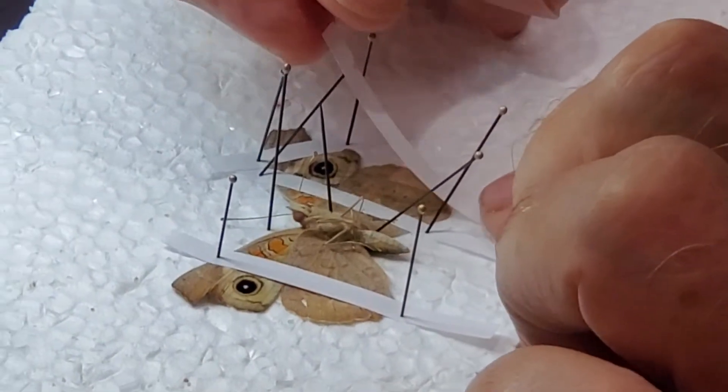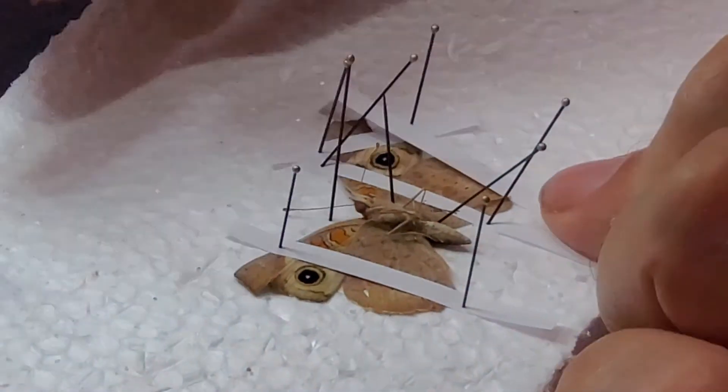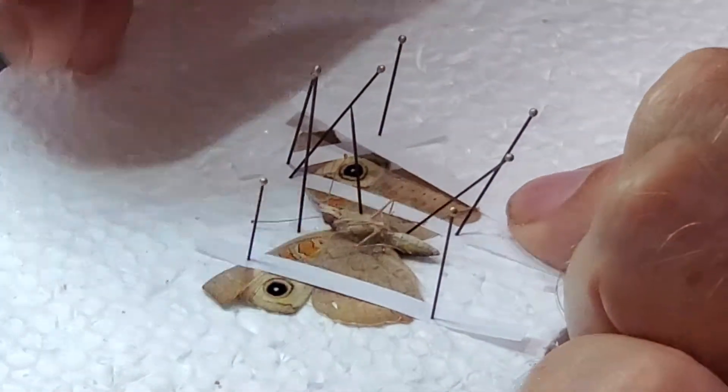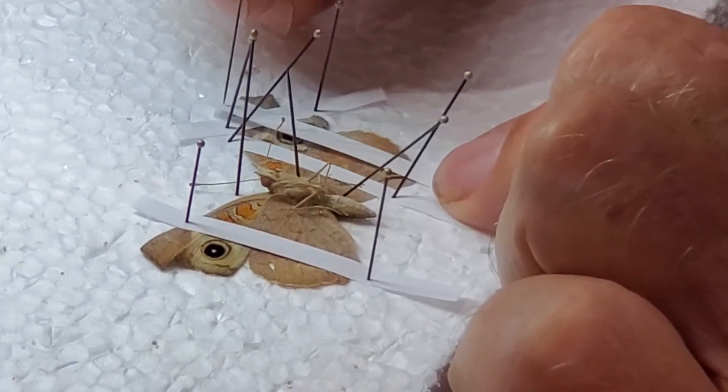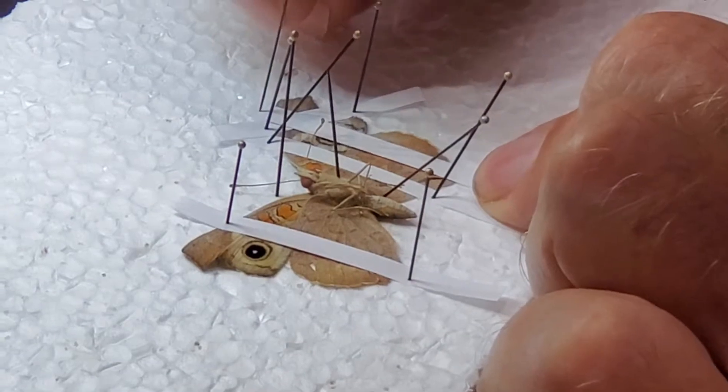Okay. If this was my collection, I would add another pin there. I try not to go through two or three layers of paper because they're hard to get apart without wrecking the specimen.